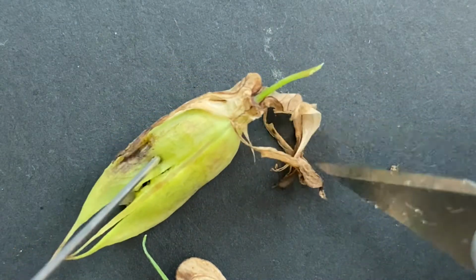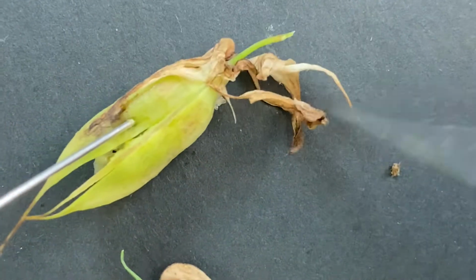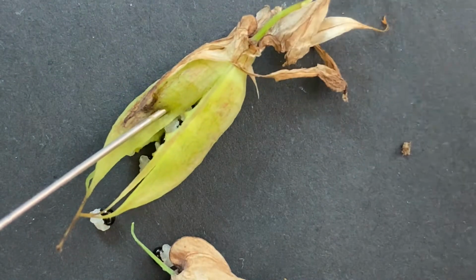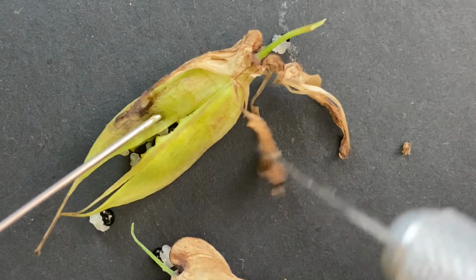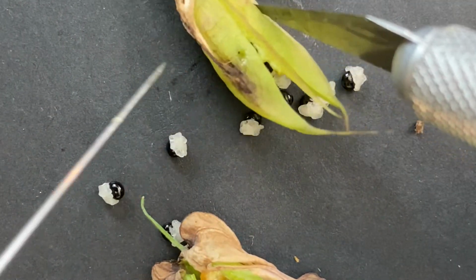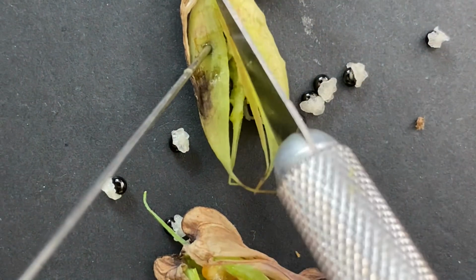And then, hard to see, hard to identify as it goes along, but the sepals really want to stay. This part right here that's looped together, that is the corolla. It's just totally dried up. All right, this ovary is starting to open up. No problem. It is ready to open.